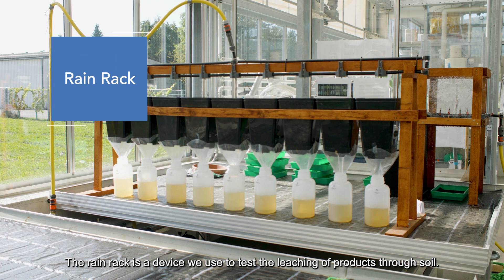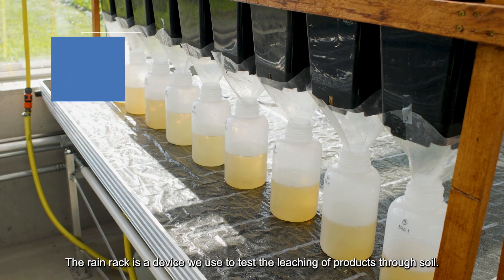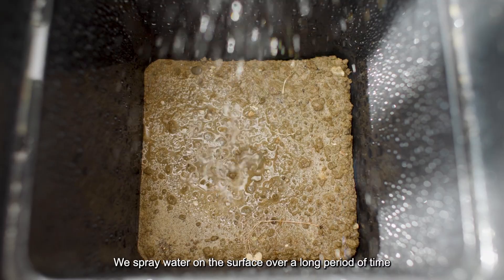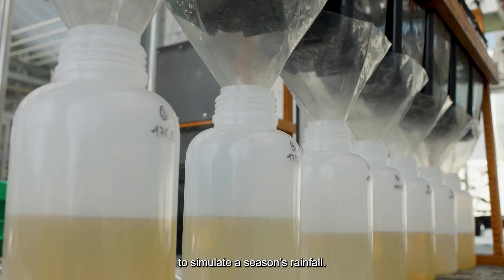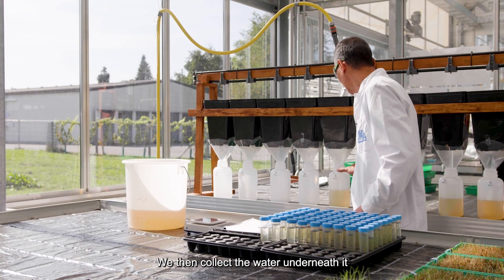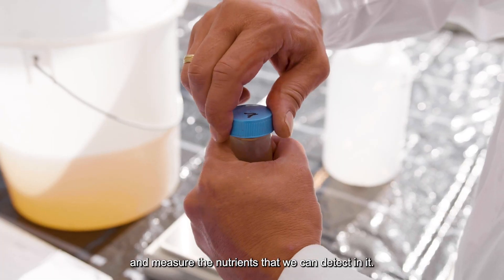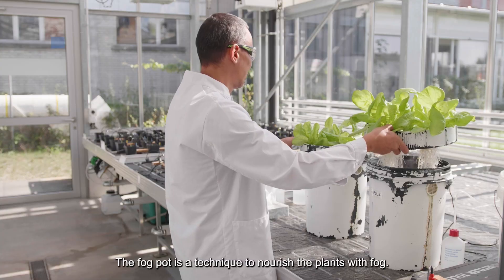The rain rack is a device we use to test the leaching of products through soil. We spray water on the surface over a long period of time to simulate a season's rainfall, and then collect the water that comes underneath it and measure the nutrients we can detect in it.